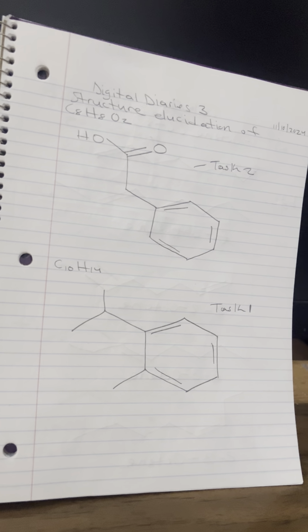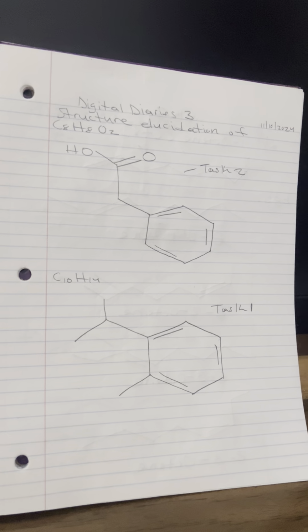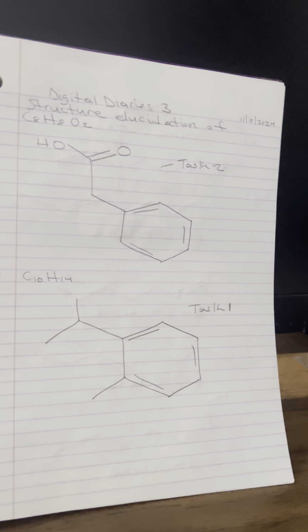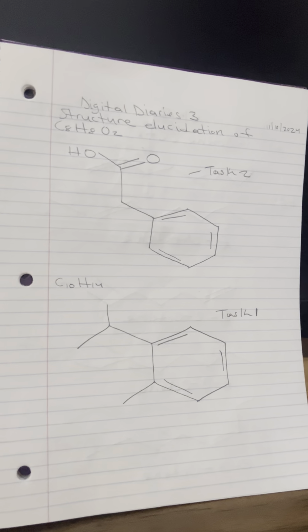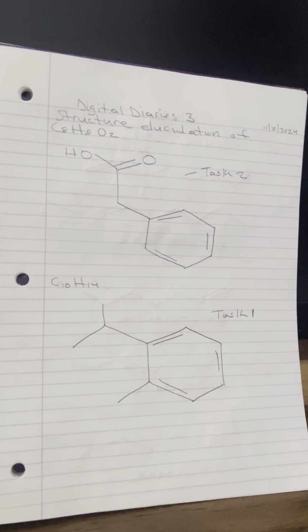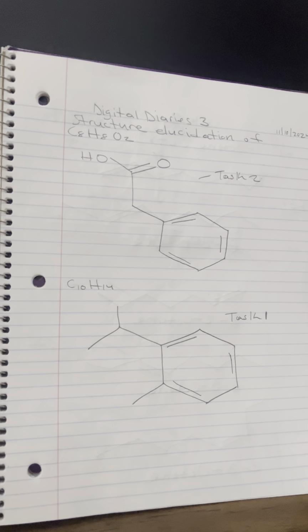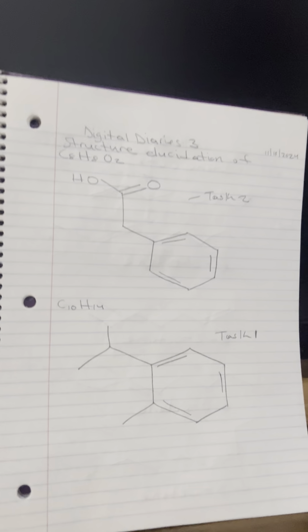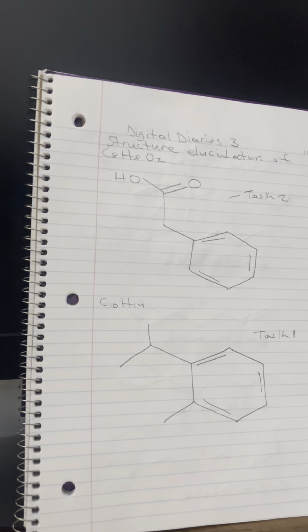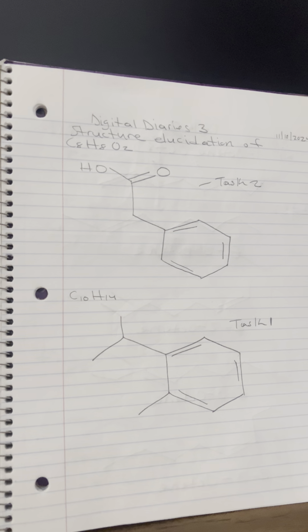And then the peaks are at 7.78, 7.22, and 7.11 ppm. These shifts are in the aromatic region, approximately 6.5 to 8 ppm, indicating the presence of an aromatic ring. The integration areas 0.19, 0.10, and 0.19 suggest these peaks correspond to 4 hydrogens in total. A common structure with 4 aromatic hydrogens is a substituted benzene ring, where these peaks could represent hydrogens in different electronic environments due to substitution.